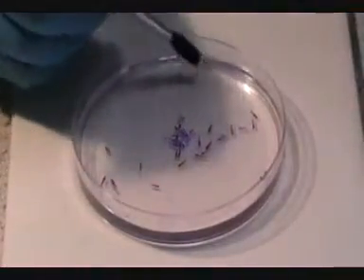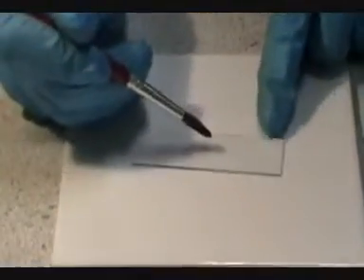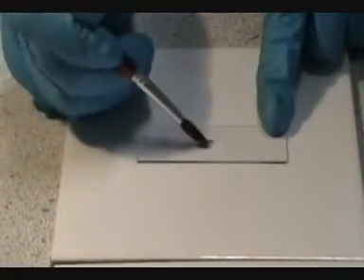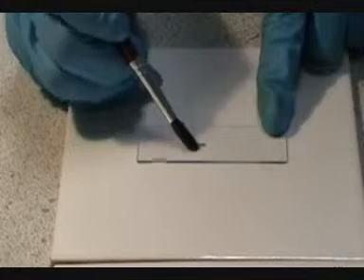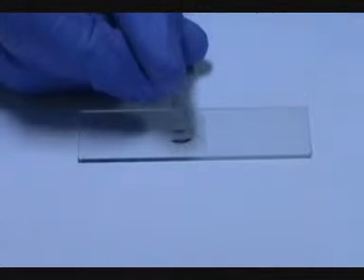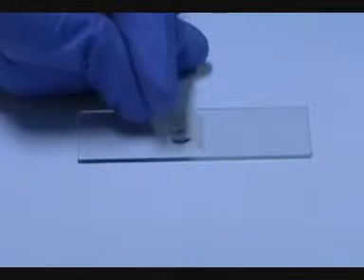Using a brush, carefully transfer a root tip onto a slide. Add one drop of 45% acetic acid directly onto the tip. Then carefully lower a cover slip over the specimen, trying not to include any air bubbles.